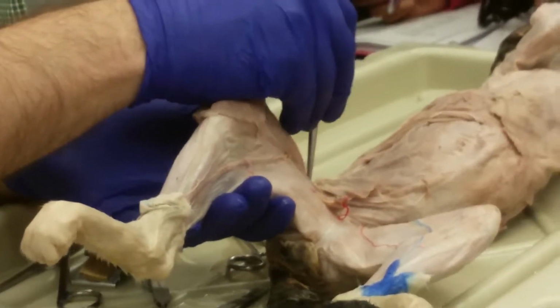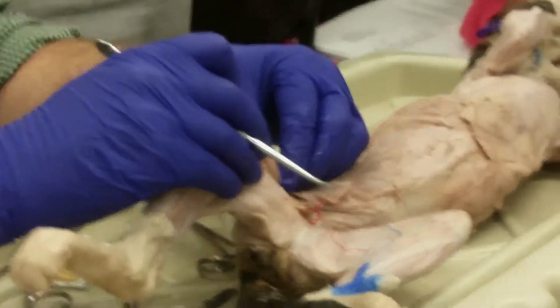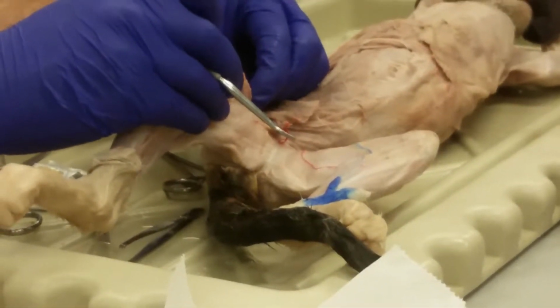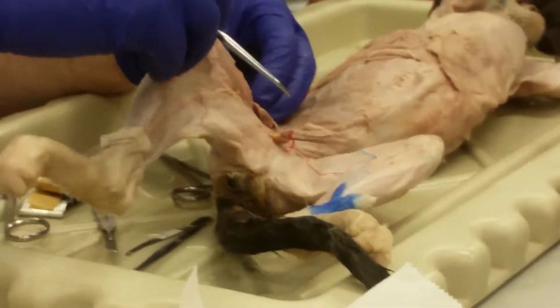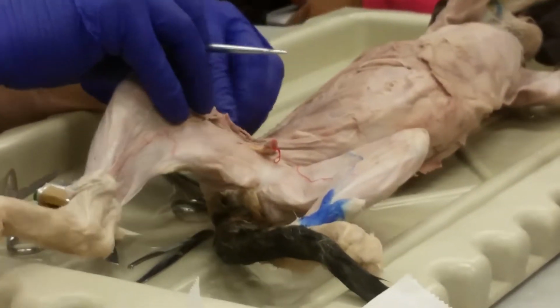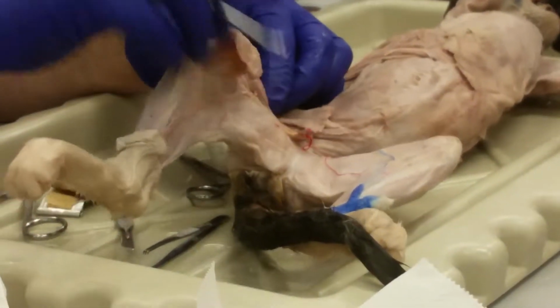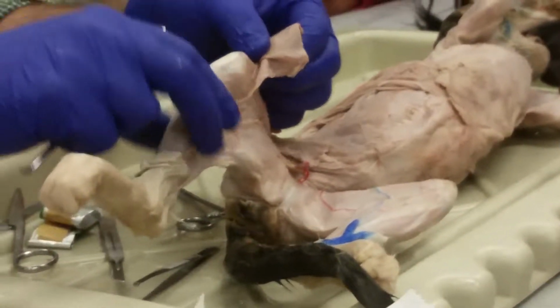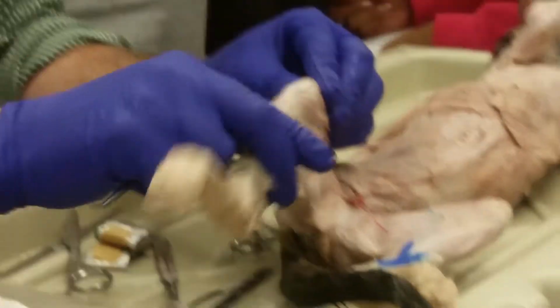The rectus femoris originates in the pelvis. Okay, so because the rectus femoris originates in the pelvis, it crosses the hip joint in the front. So what's it going to do? Crossing the hip in the front, it will flex. Okay, so we've got two muscles that can flex the hip in the front here: the sartorius, which I've cut. Notice I cut it in the middle so I can put it back together and see where it went. And then the rectus femoris. The rectus femoris, along with the other three vastus muscles, also cross the knee joint in the front. So what are they going to do? Extend, right? Those are the major extenders of your knee.